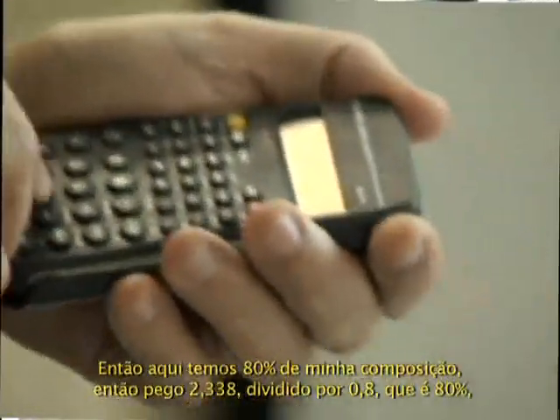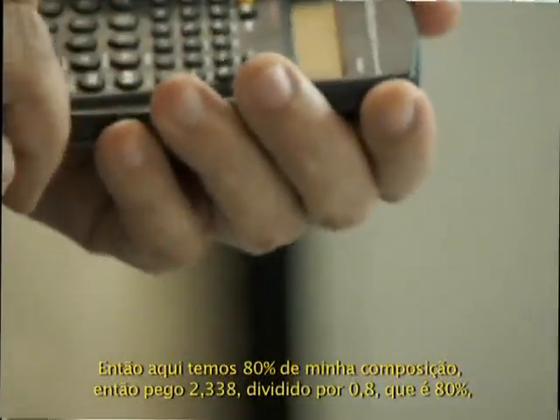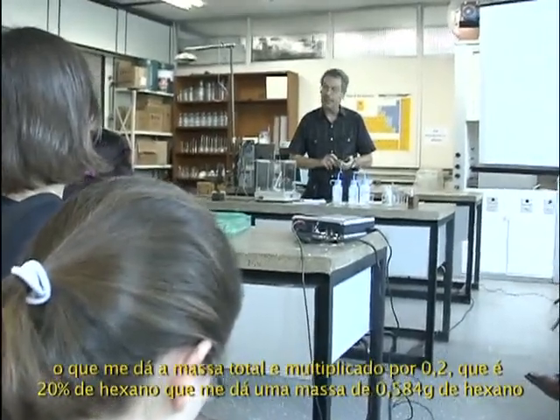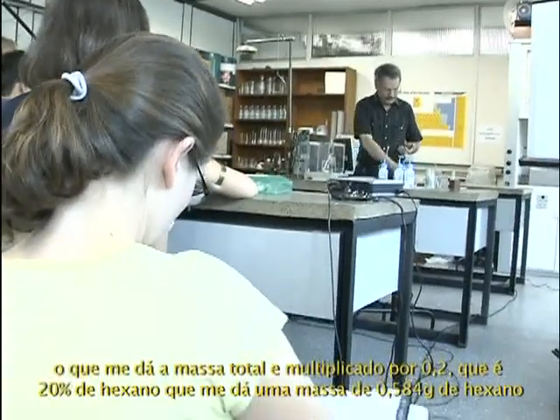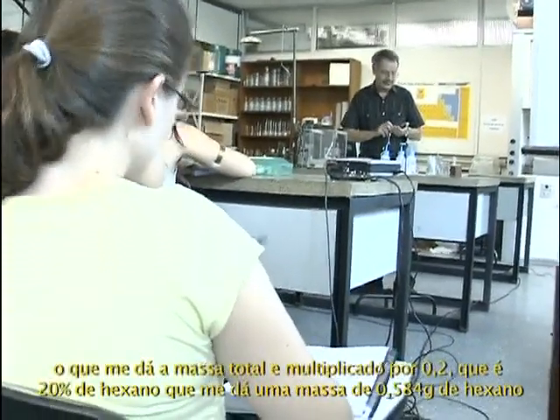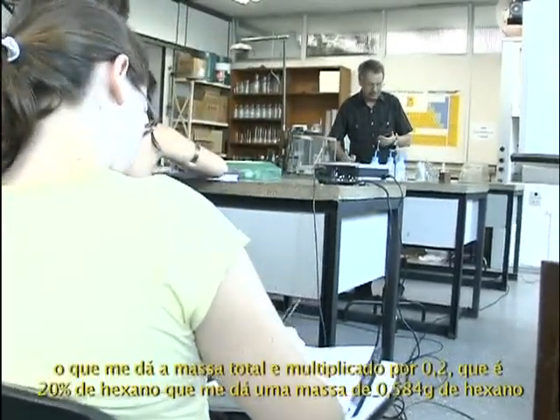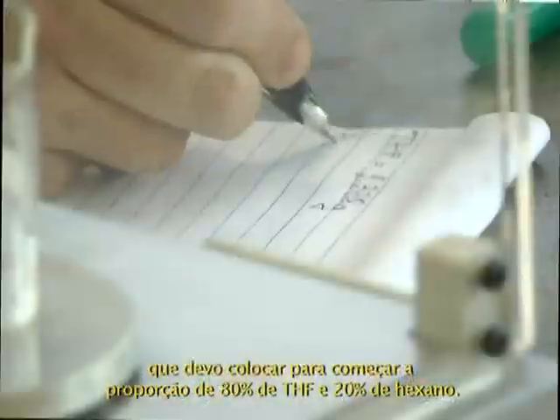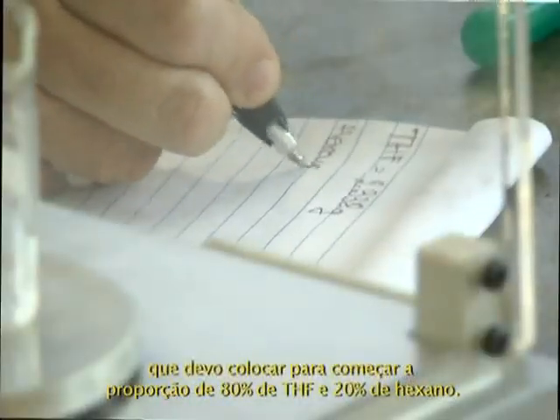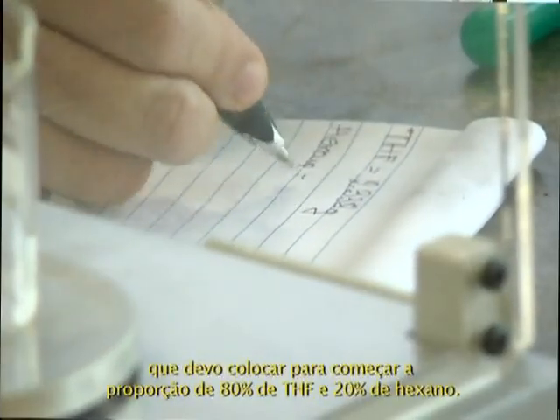I want this, so I take 2.338 and divide it by 0.8, which is 80%. That gives me the total mass, and I multiply by 0.2, which is 20% hexane, and that gives me 0.584 gram, the mass of hexane I should put in to start with the 80% THF, 20% hexane proportion.